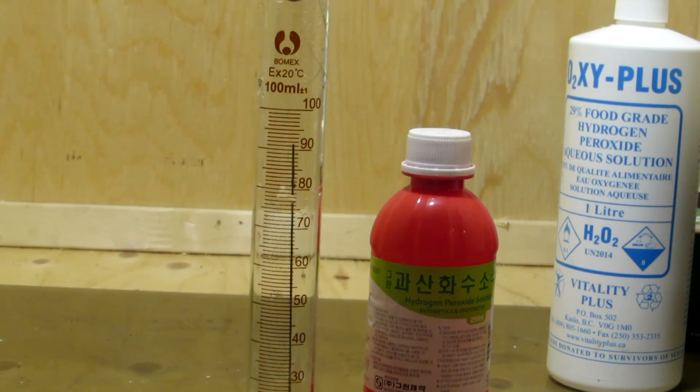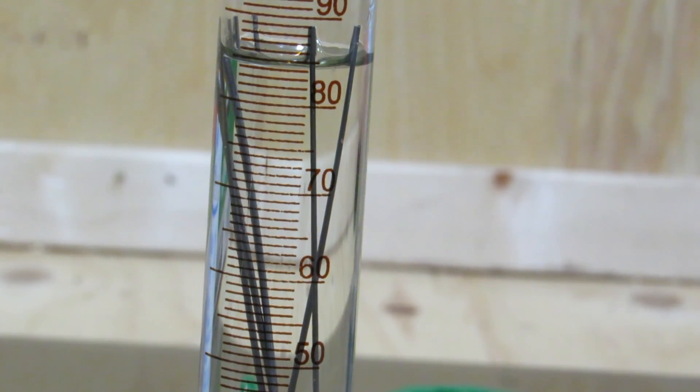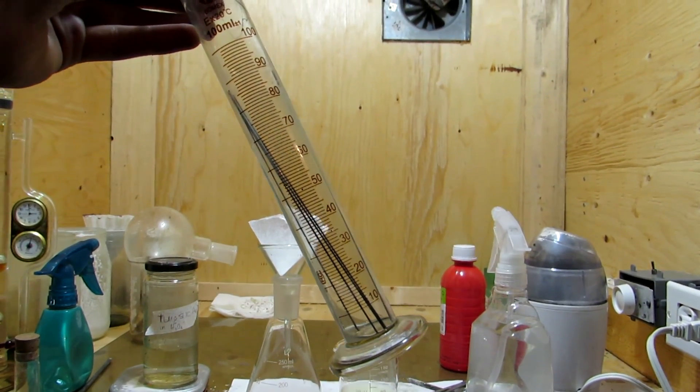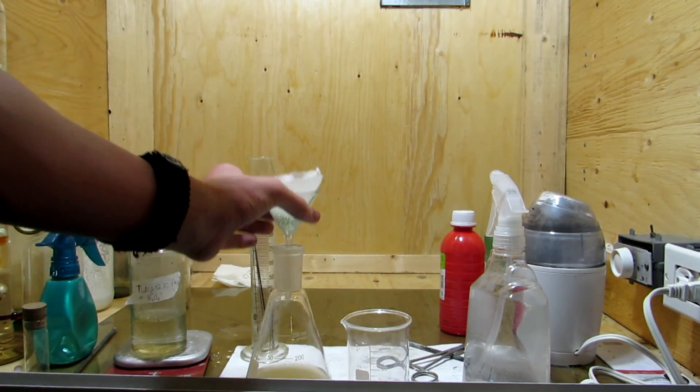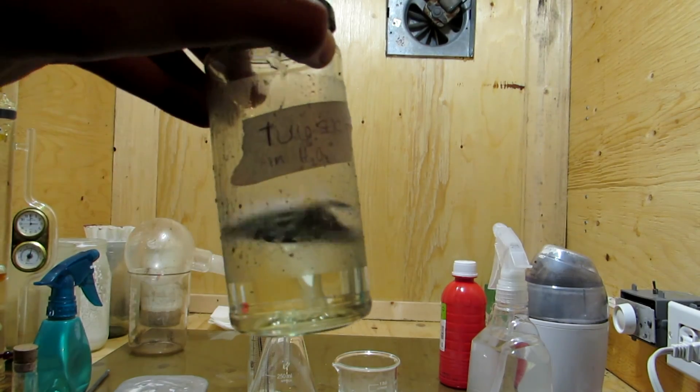After placing 5 rods in a graduated cylinder and leaving it in 30% hydrogen peroxide for 2 months however, only 2 grams of the rods dissolved. I filtered the solution to obtain a bit of thorium dioxide that was liberated and then saved the tungstic acid solution.